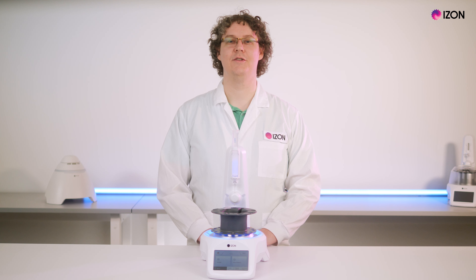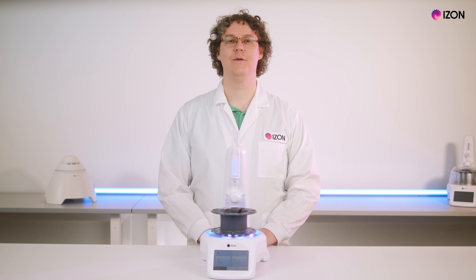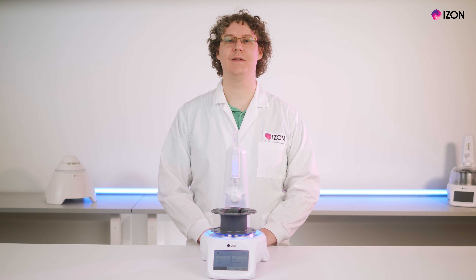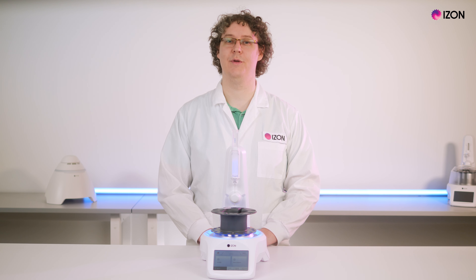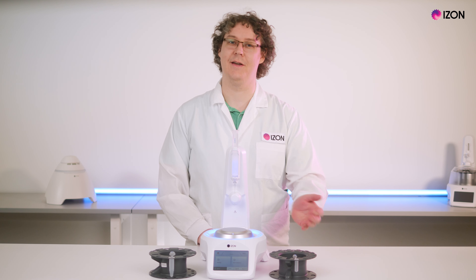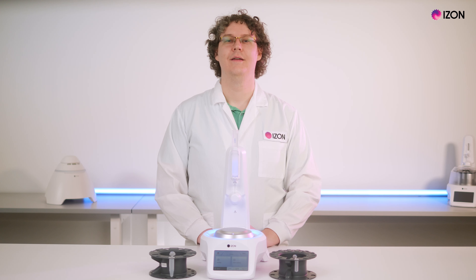Your chosen collection schedule will vary slightly, depending on whether you are using the default AFC settings, or have adjusted the settings to prioritize concentration, purity, or recovery. When using a QEV single, the total collection volume could fit into a single tube placed on the side of the carousel which takes smaller tubes. For the QEV original and QEV1, however, this may not always be the case.